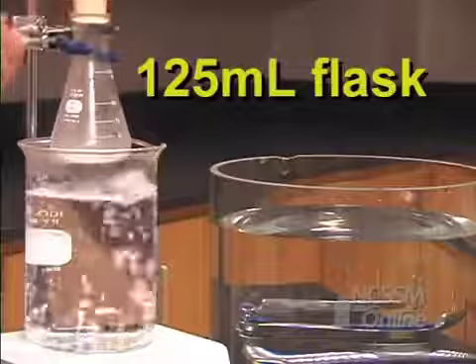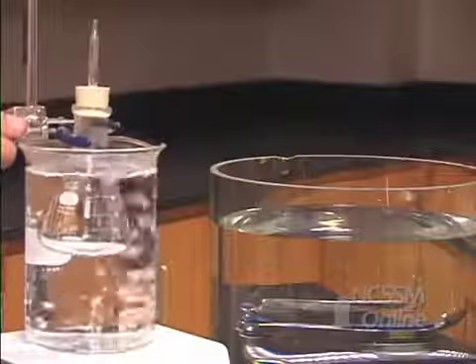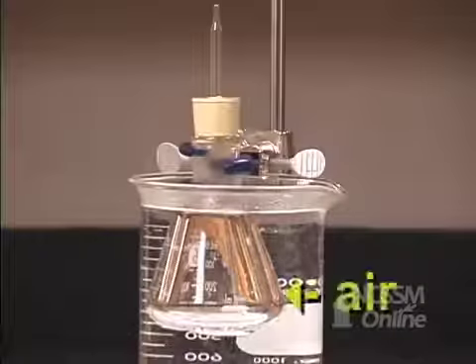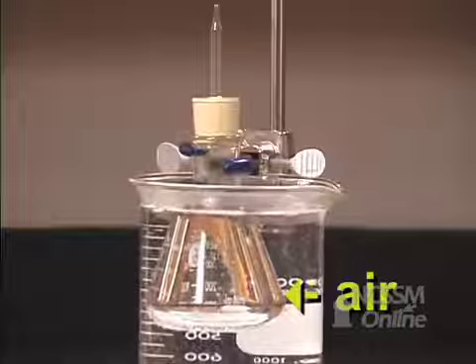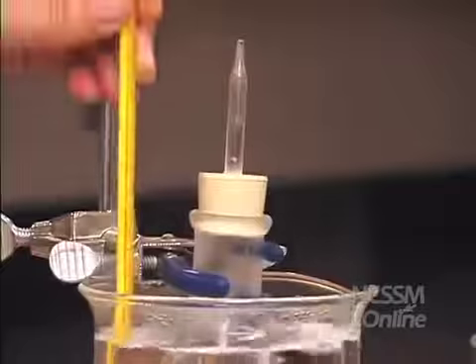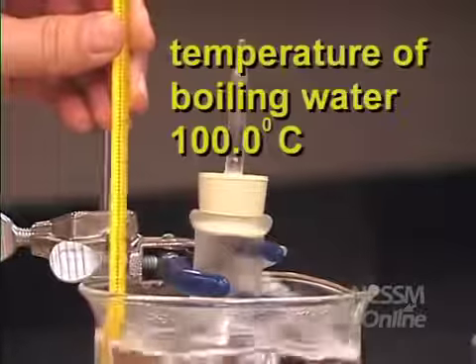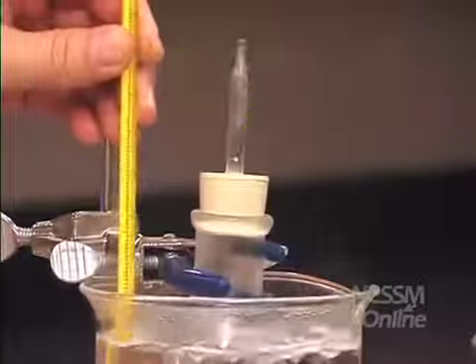We will wait for a few minutes so that the gas inside the flask reaches the same temperature as the boiling water bath. The gas inside the flask, which is air, will expand as it's heated. When the air inside the flask comes up to the same temperature as the boiling water bath, there will be just enough air in the flask to fill the flask at the boiling point of water.